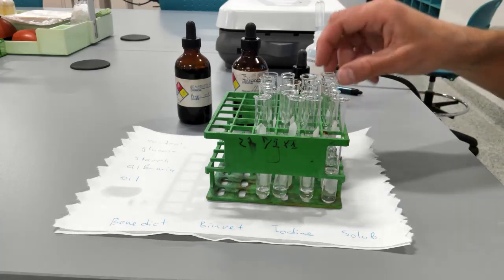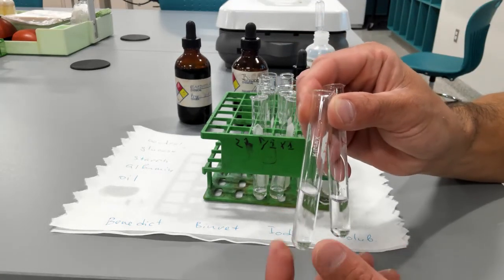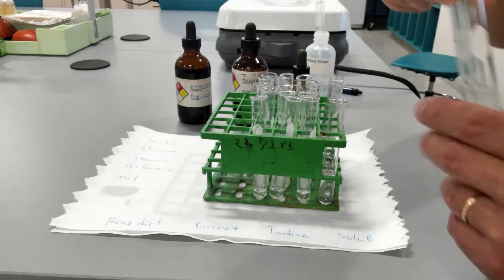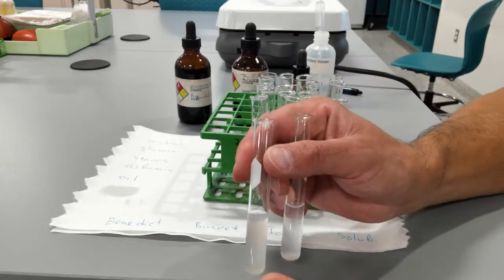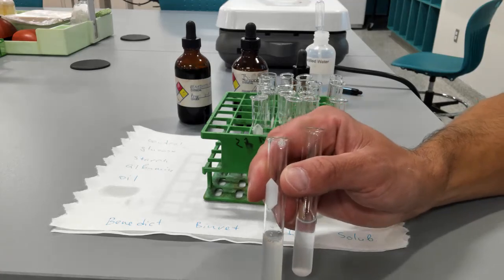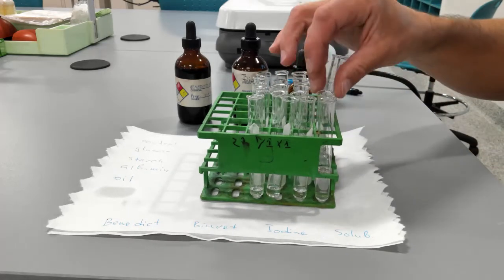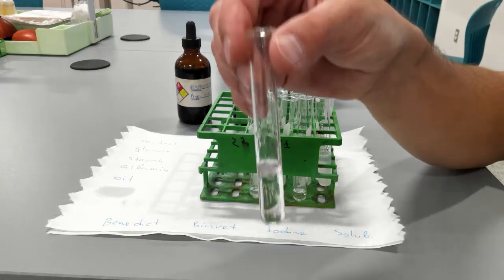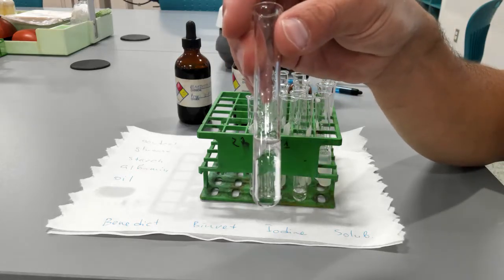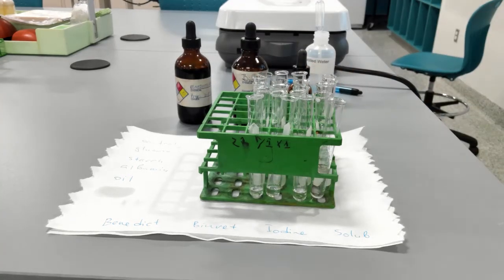So what can we see? We can see that the glucose here, this tube, and just water don't really look different. Glucose forms a true solution. Albumin, this tube, and starch, this tube, both form colloid solutions in water. So it's not a true solution, but it's a pretty good colloid. And now we can look at corn oil, and you can clearly see that corn oil floats on top of water. They don't mix with each other. So obviously corn oil is not soluble in water.